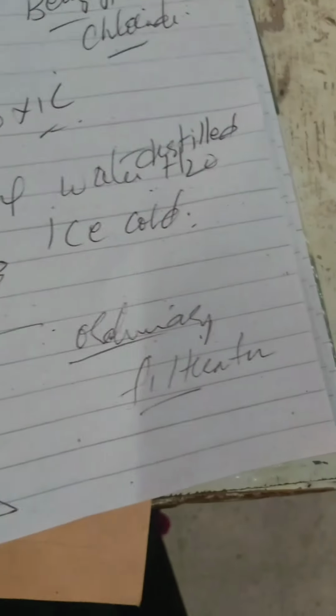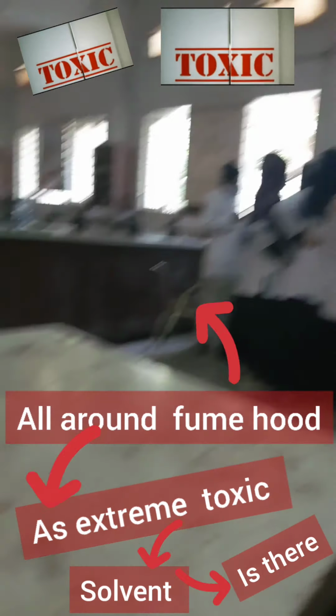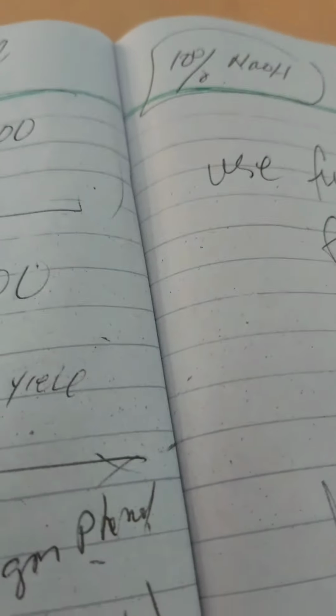So this is still the filtration. Now they will recrystallize the compound. They are over here now at the fume hood, because they are now learning how to use it. After using the fume hood, they will simply mix the compound in the fume hood, the pungent ones, the volatile ones, that's it.